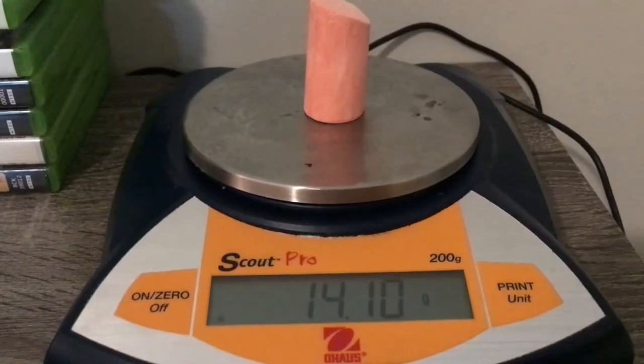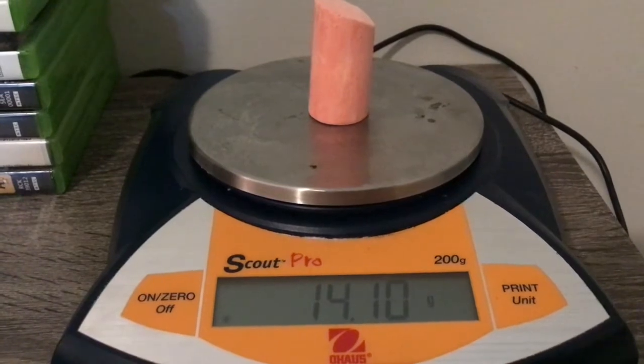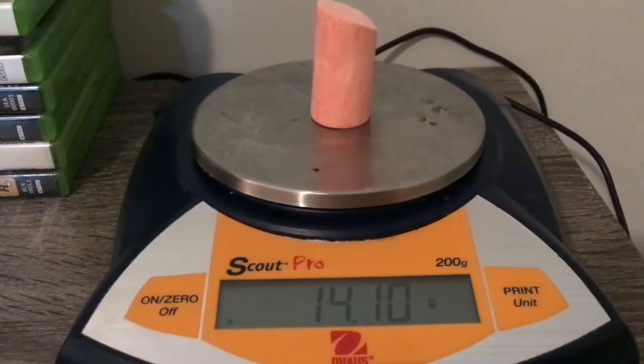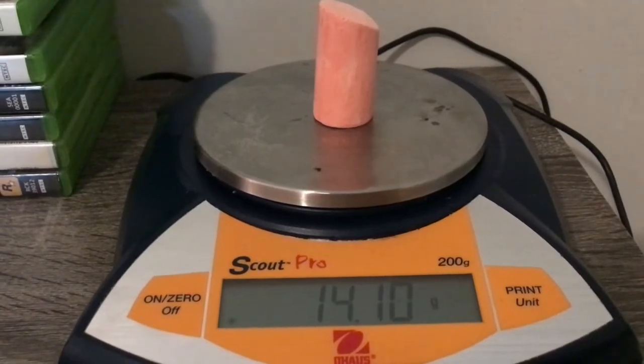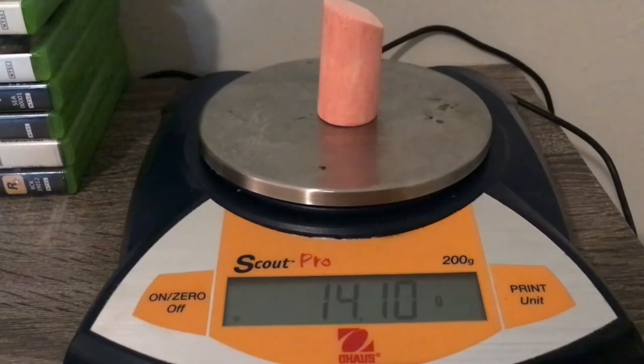You don't have to write your name — you can write anything you want, you just have to leave some chalk on the sidewalk. So step one, we have to weigh this chalk. I'm going to turn on my balance, and it looks like the mass of my chalk initially is 14.10 grams.